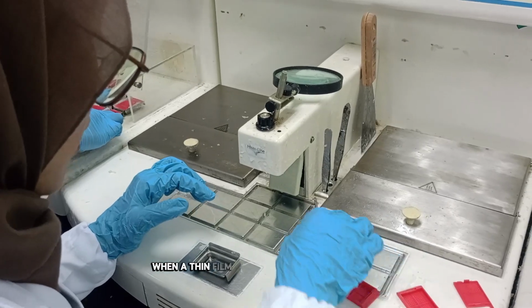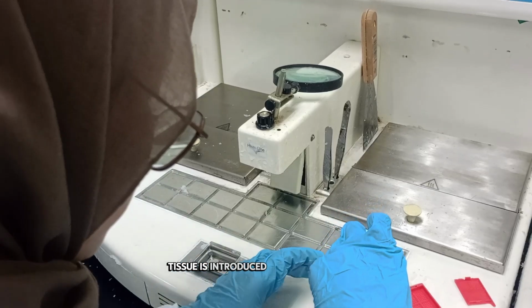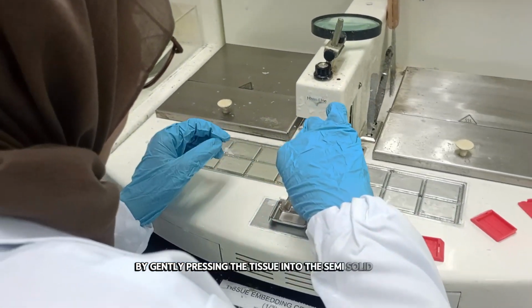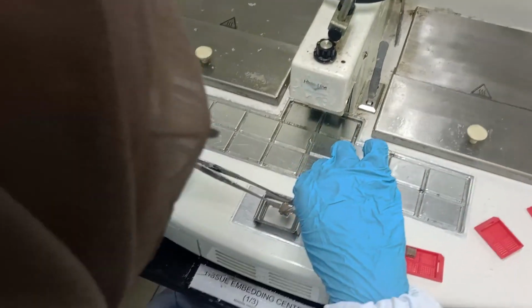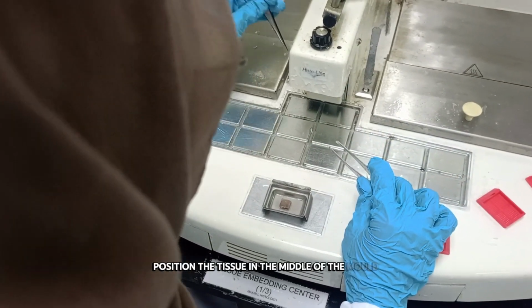When a thin film of semi-solid wax has formed, the tissue is introduced with warm forceps by gently pressing the tissue into the semi-solid wax. Position the tissue in the middle of the mold.